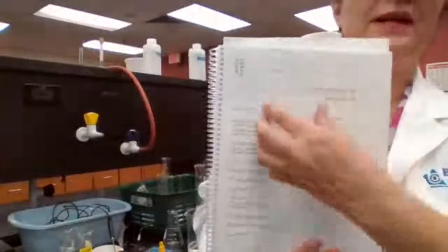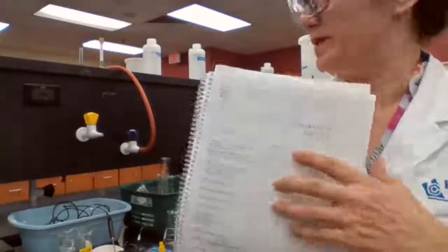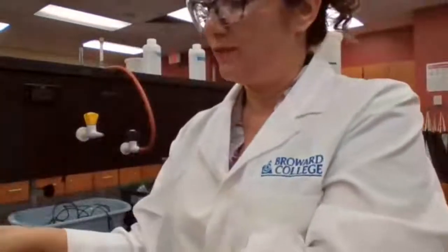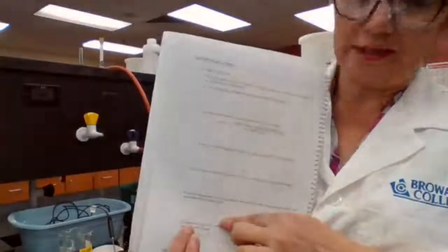So when you are doing your calculation, you have all the information. Some of them, they are the same, like the volume didn't change, volume of the flask doesn't change. It's the same barometric pressure because the room pressure is the same for both 1 and 2. And then when you have your numbers, then you answer your questions and do calculation, also additional questions on the other side of the data sheet. Okay, it wasn't too bad.